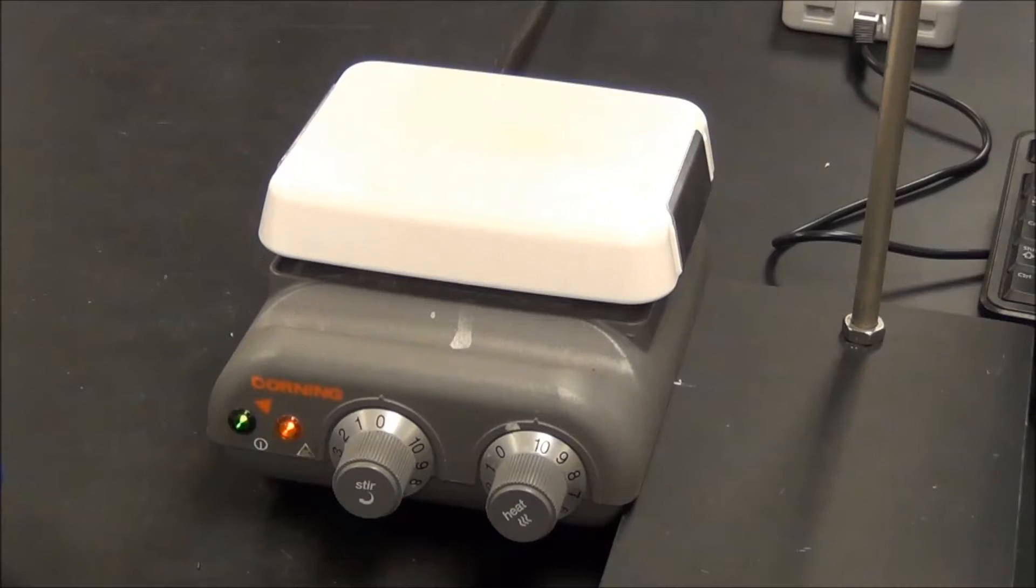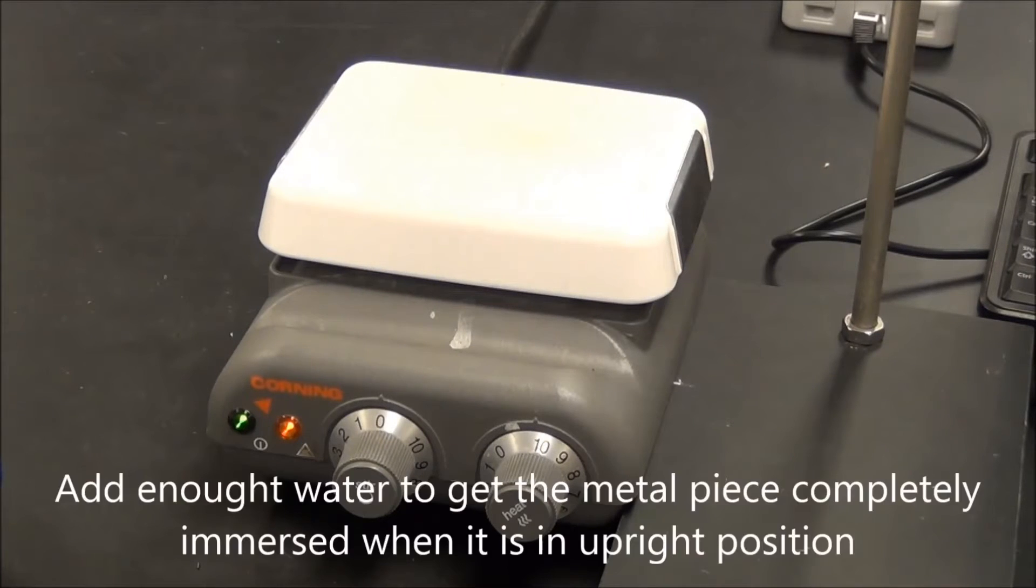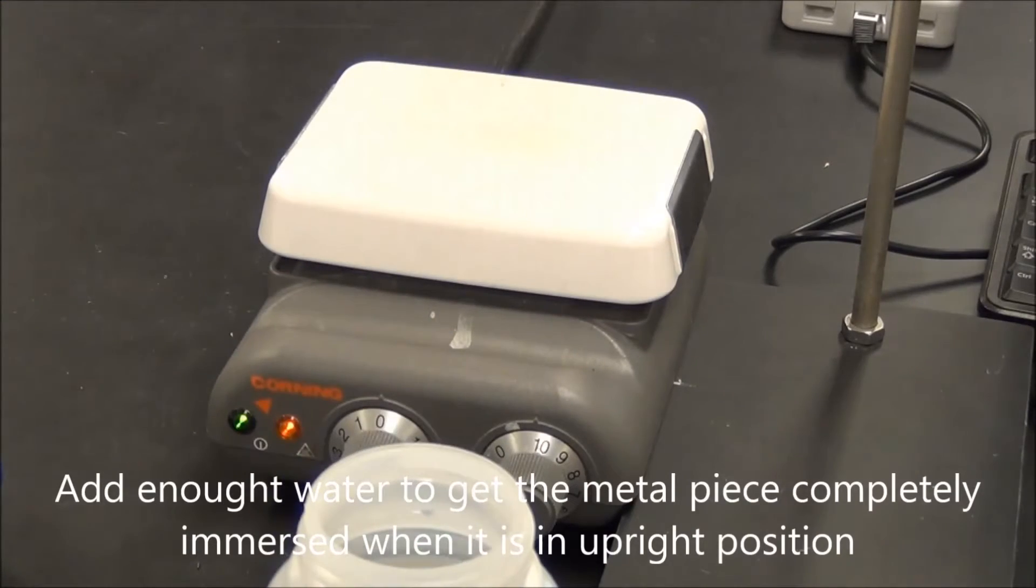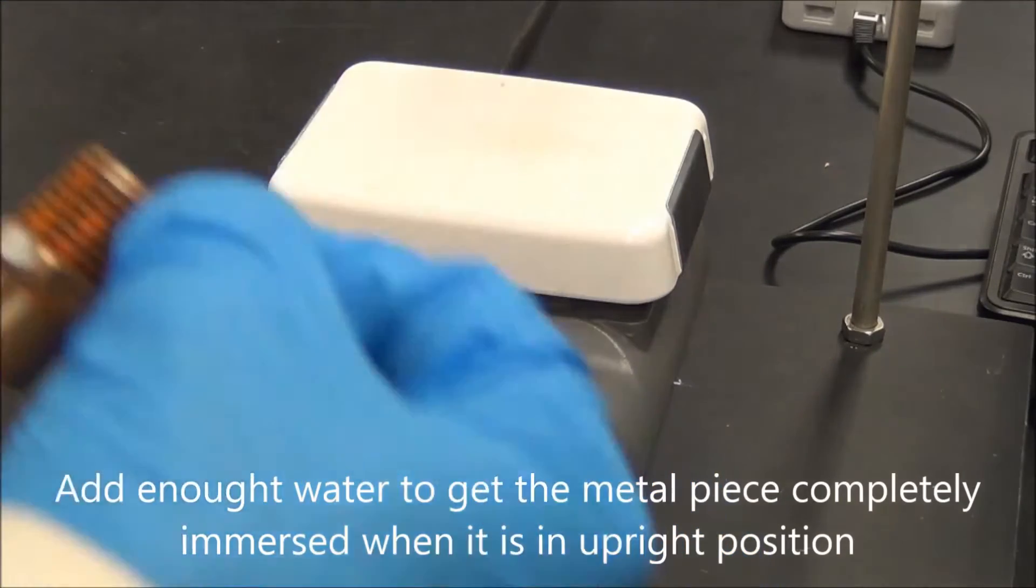In order to save time, you do not want to add a lot of water into the glass beaker. All you need is when you add water and the metal piece is immersed in the water.